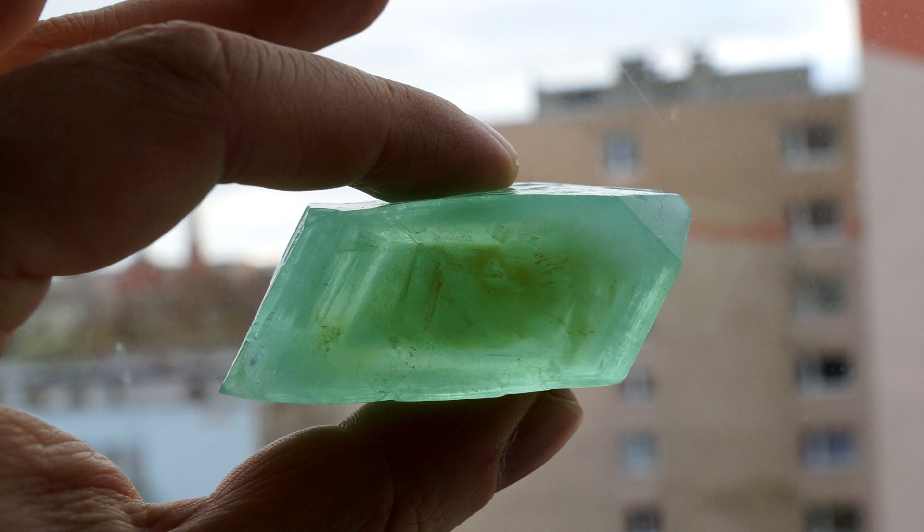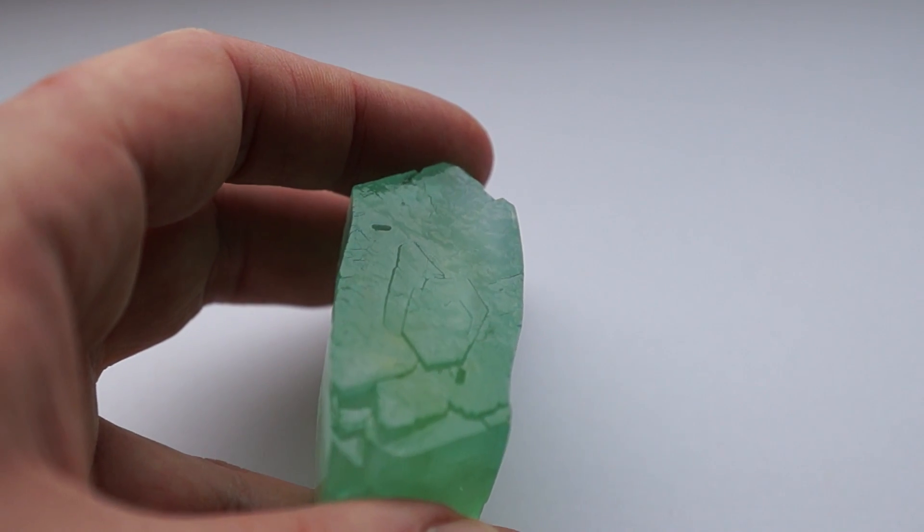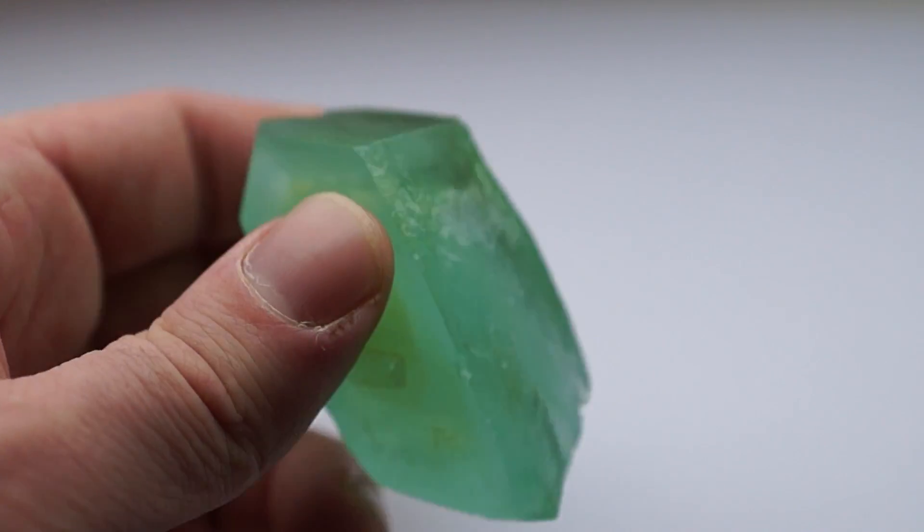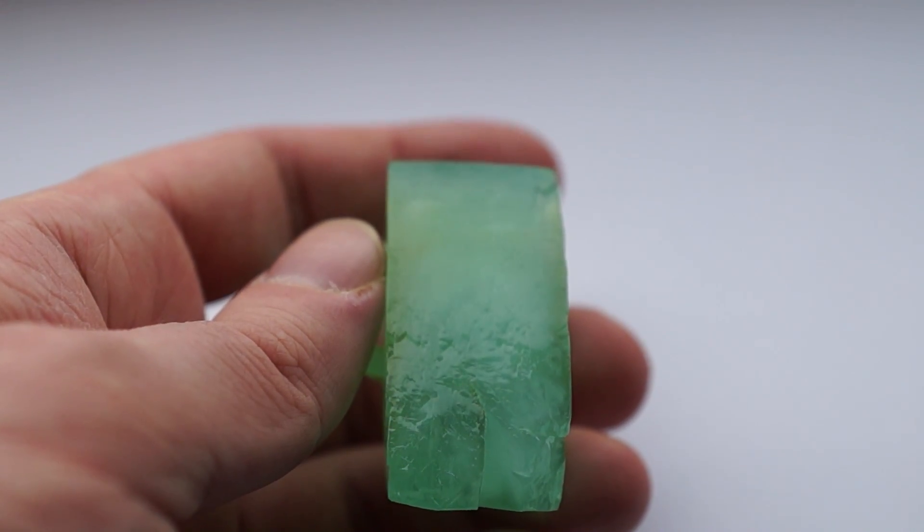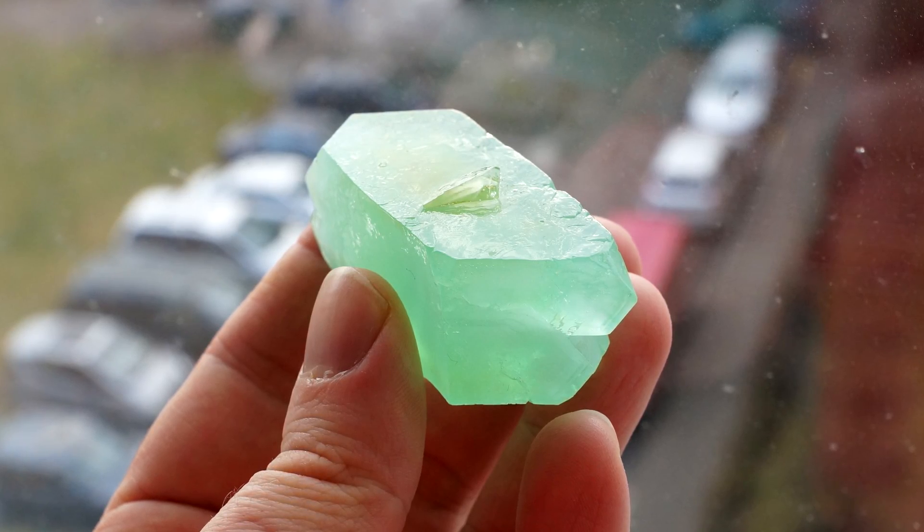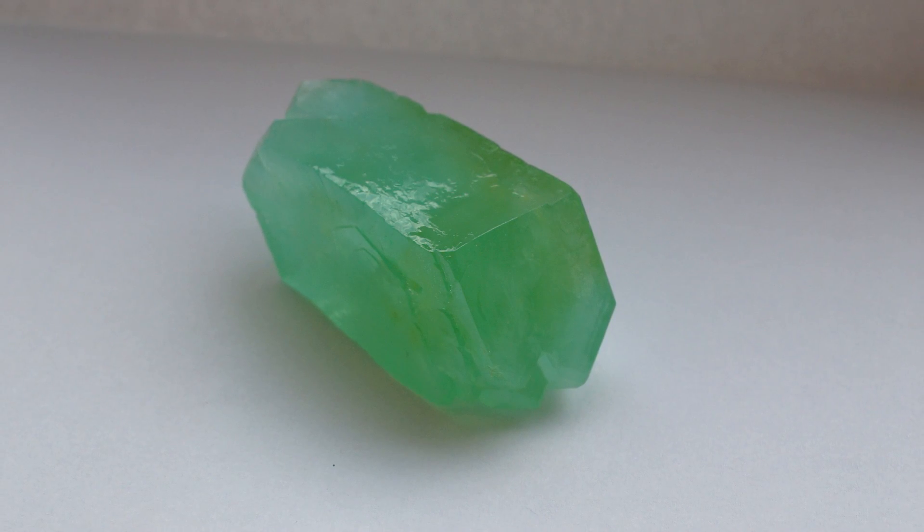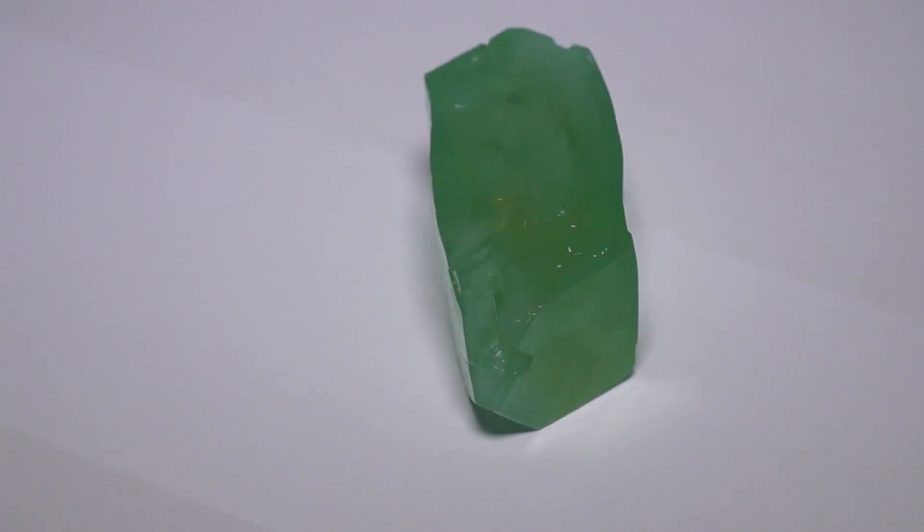Ideally, the crystal must be transparent. The defects in the crystal are due to temperature fluctuations during growth, the presence of dust in the solution, and the resulting iron oxide contamination. However, the crystal of Mohr's salt is still quite beautiful and can be a nice decoration in the house, although in practice this crystal can hardly be applied anywhere.